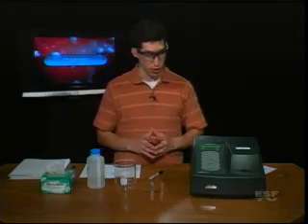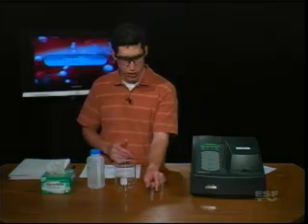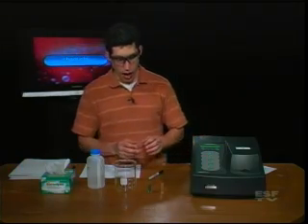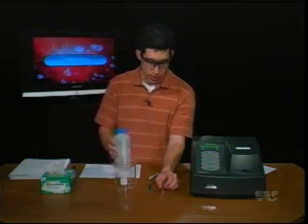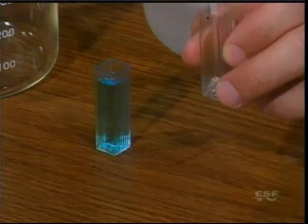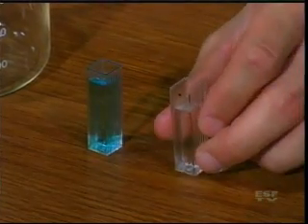So let's first begin to measure the absorbance of this blue solution. To measure the absorbance, we have to know what the absorbance of the background is, because the blue solution here in this case is just water and food coloring. So the background — what I'm not interested in — is the water. So I'm going to first fill my cuvette with some water as my background solvent.